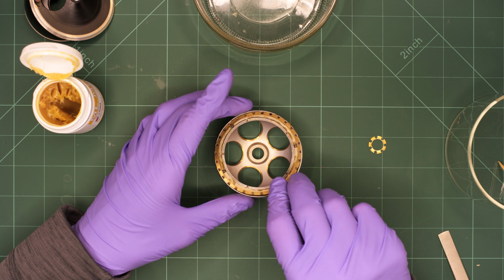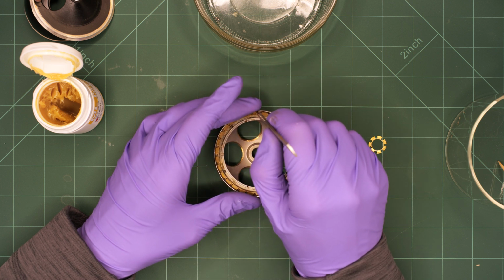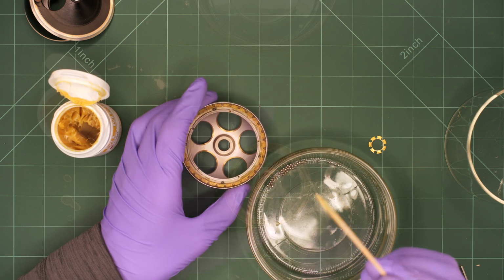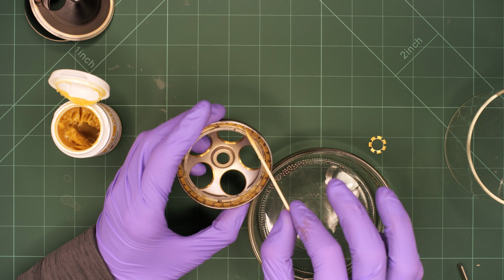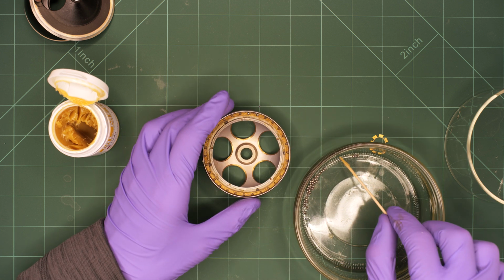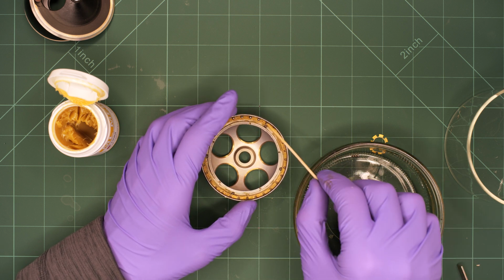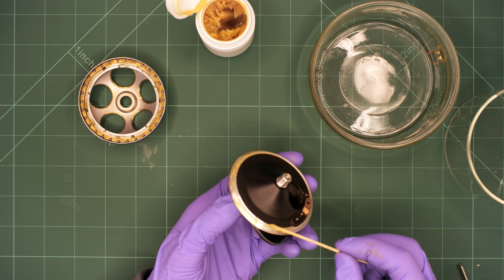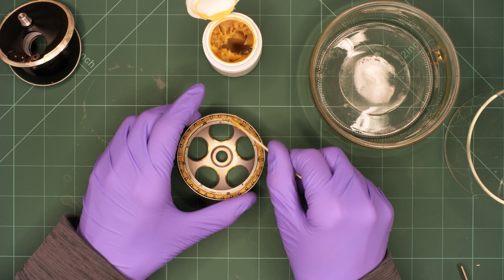We insert the brass ring again, push it down and add additional grease. We can now start adding the ball bearings again. I use the same toothpick that I also used for the lubrication process. Due to the remaining grease, the metal balls stick to the tip and can easily be placed at the right spot. After the ball bearing is complete, it's time to lubricate the other half of the nosepiece. Before starting the assembly process, I add an additional layer of grease on top of the ball bearing.